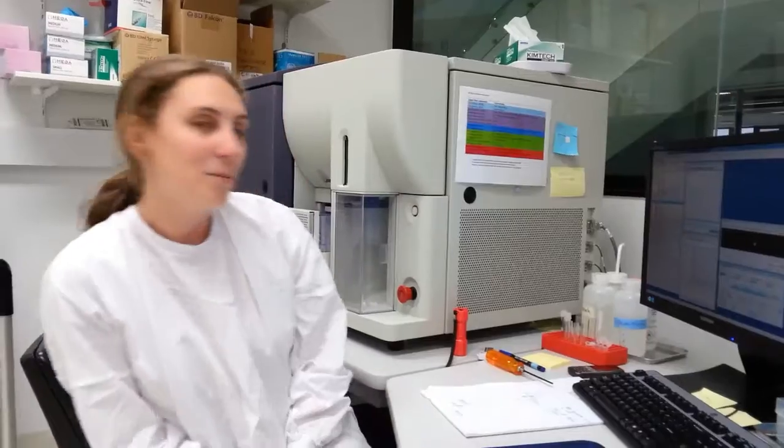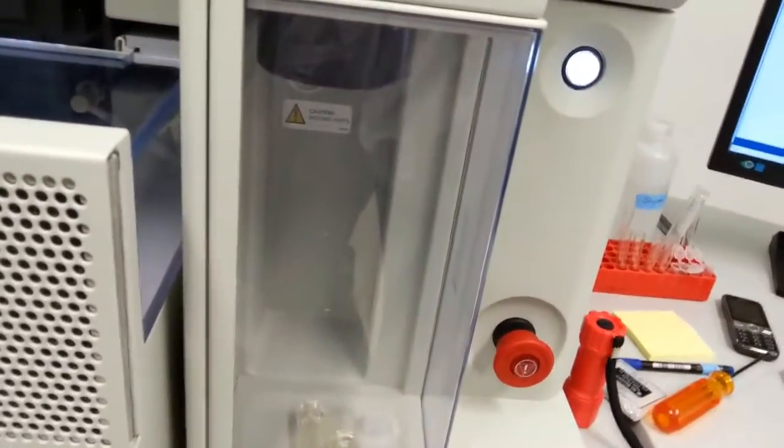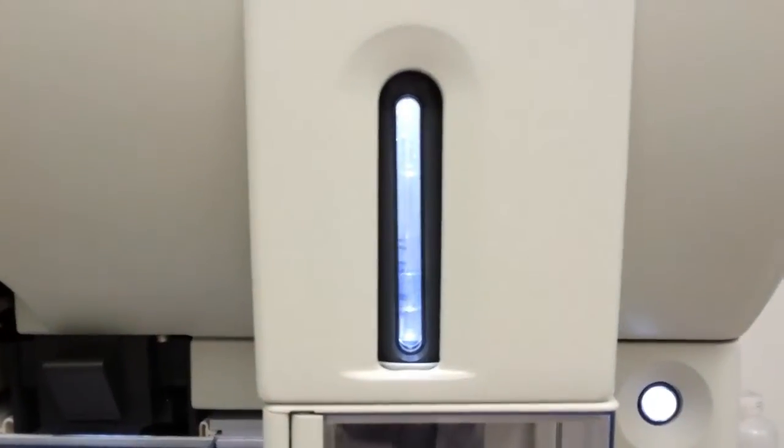Whee! The machine's running my sample right now. Don't push the button with the exclamation mark on it. Don't push the button. It's even got an exclamation mark on it. That's spinning!